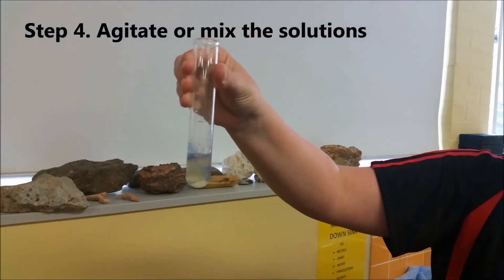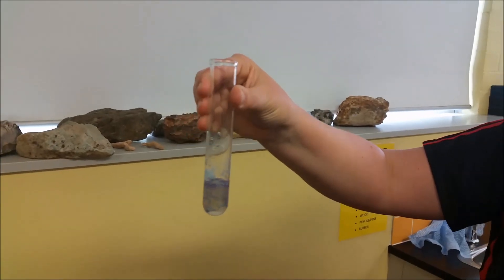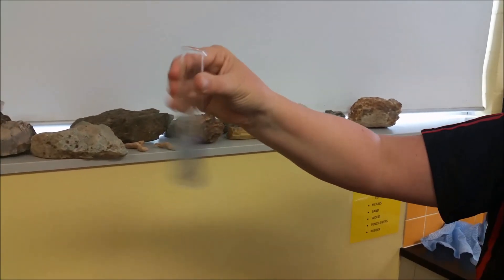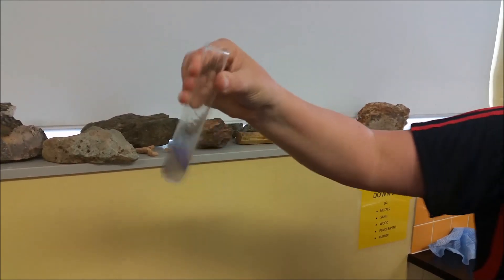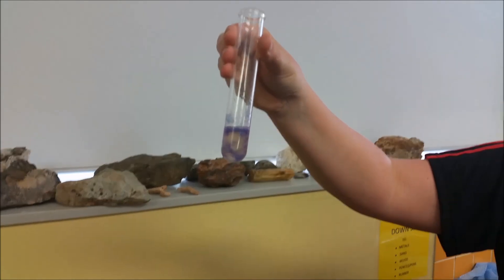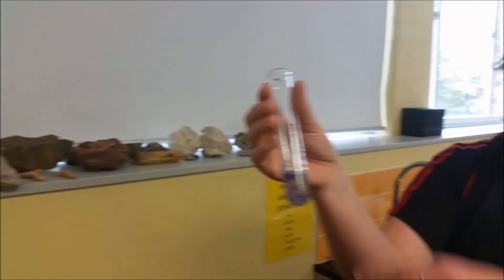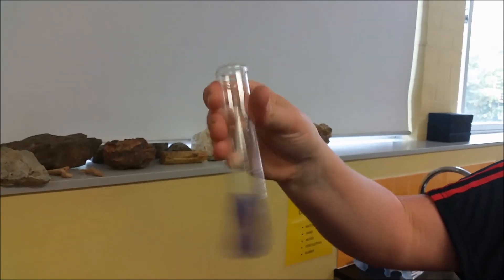Can everyone see the color change that's occurring? What color has it gone? Purple. Now that protein solution is quite thick, so it's not mixing evenly, but it is mixing.